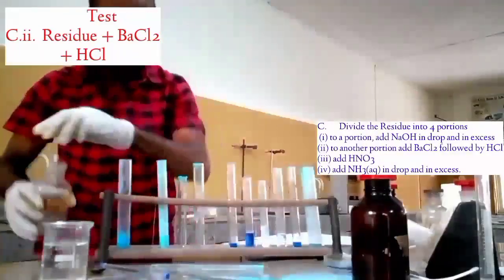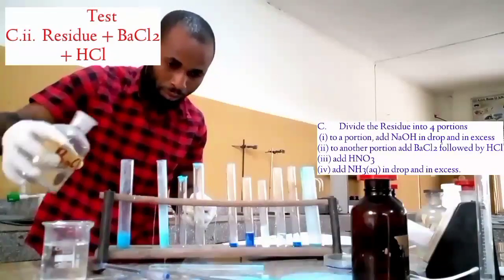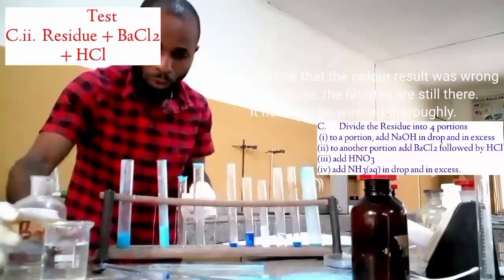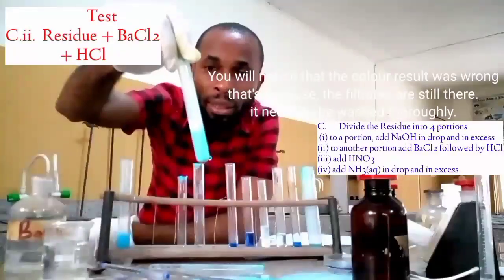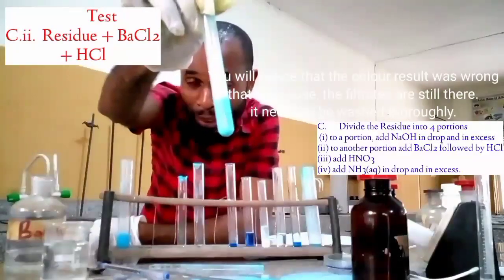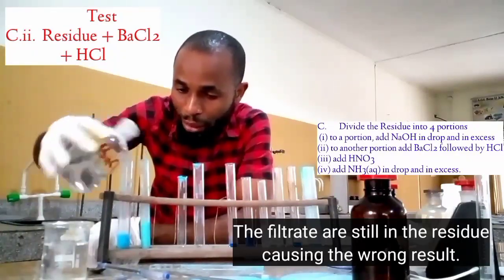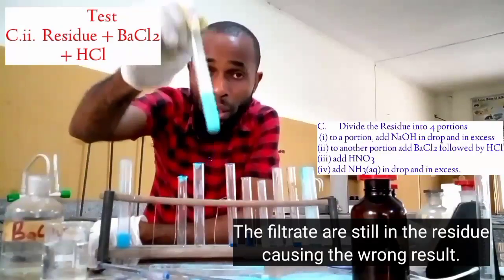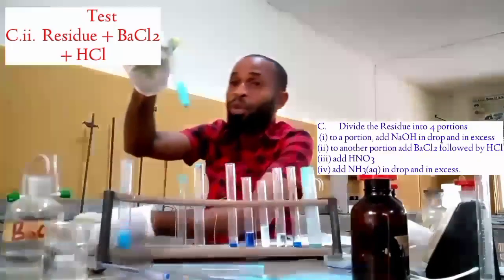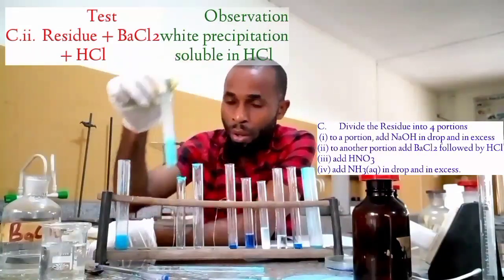We add it. If you look at the barium chloride, it is actually supposed to give us a white precipitate, although it has been affected a bit by the color. Maybe this has not actually gotten it, but when you are filling this form for WAEC, it's going to be a white precipitate, but what our eyes are seeing is not all that white, but we can still feel it.